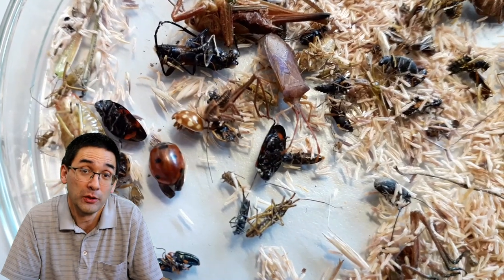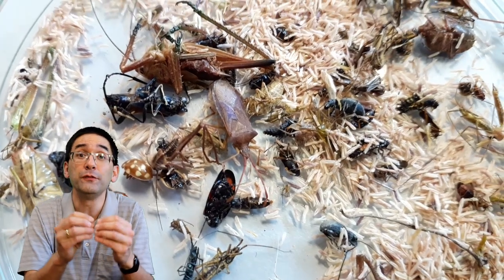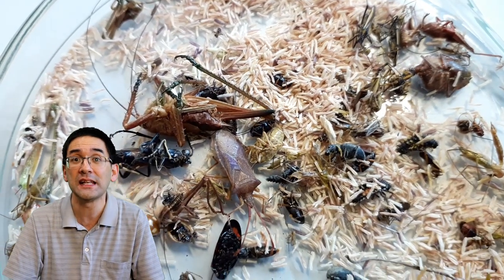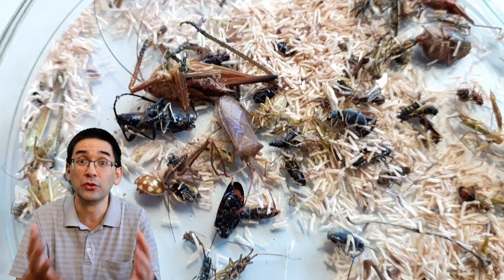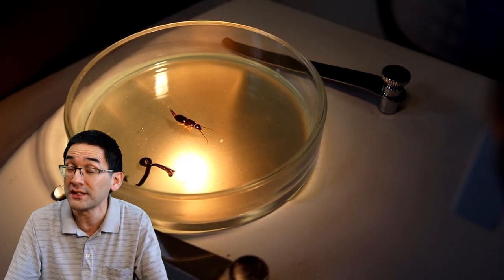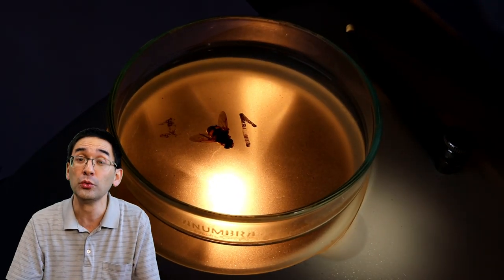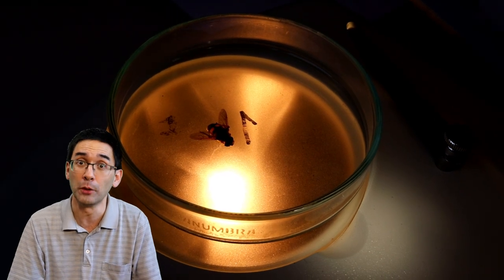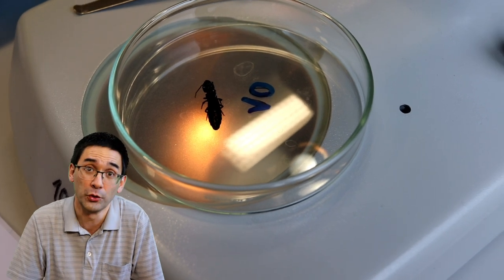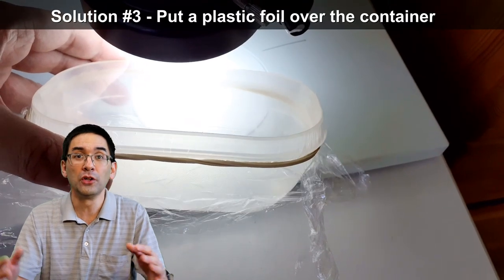Unfortunately, that's simply the way it is — you have to kill the insects, because some structures can only be seen if you separate the wings and turn the insect around, which you cannot do with live insects. It's often necessary to kill insects for a biodiversity study, for example when researching how climate change affects insect populations. Proper documentation requires catching and killing them, and then you can put them into a collection box.